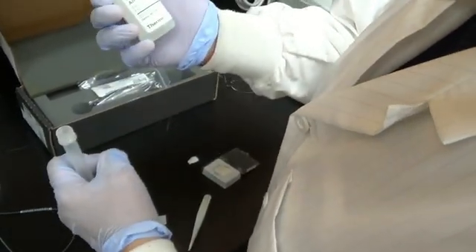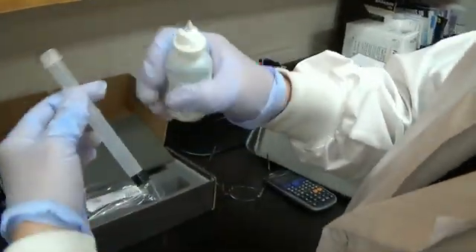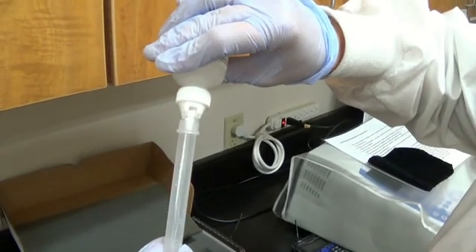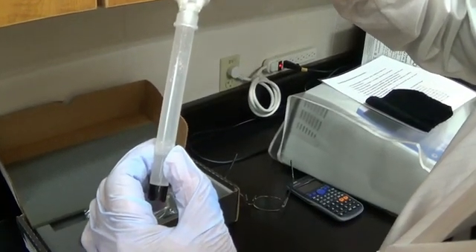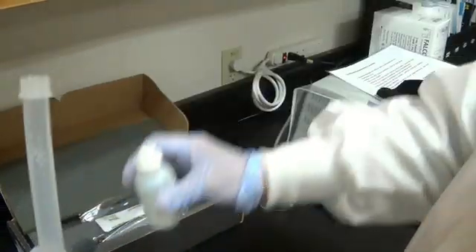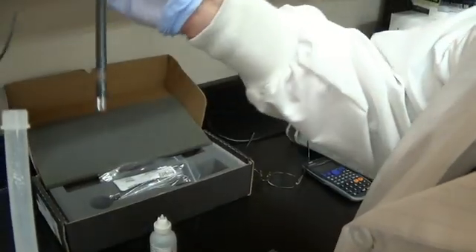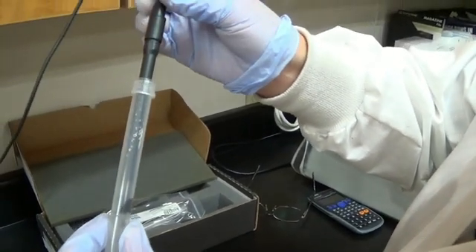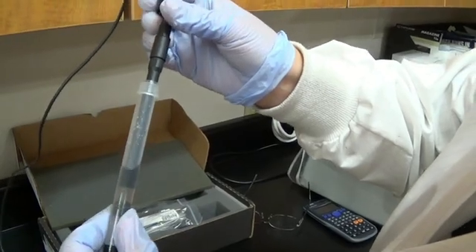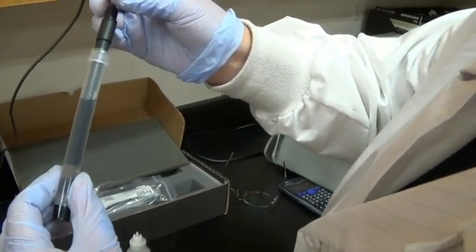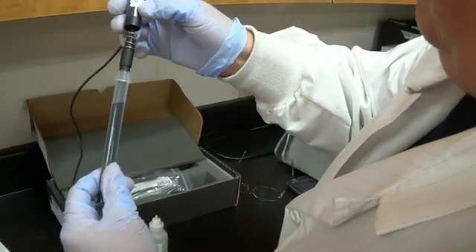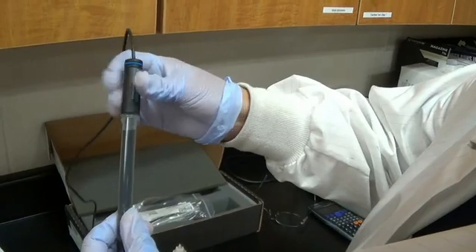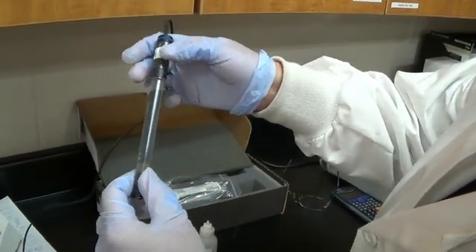And then next thing is you take the electrode fill solution. There's a little line right there. That's how far you fill it. You want to insert the center. And I kind of wiggle it a little bit when I put it in here. You don't want bubbles in the bottom. And sometimes I kind of go side by side. And I seem to get less bubbles that way. Take the top down. And there we go.